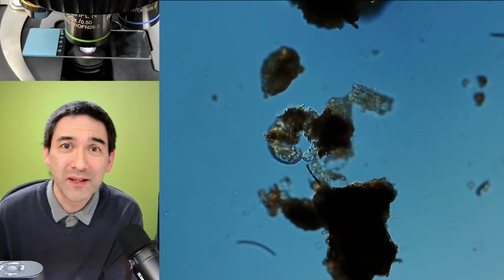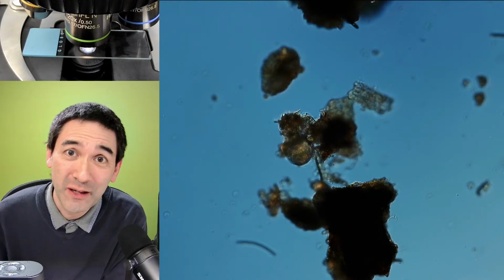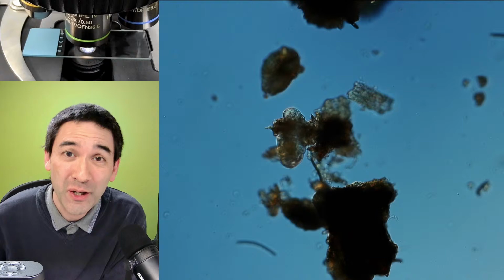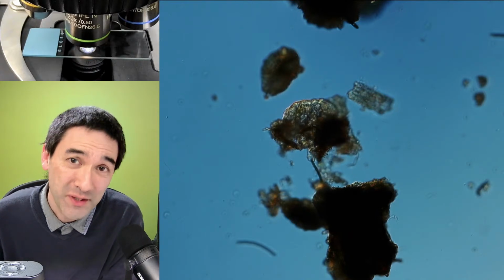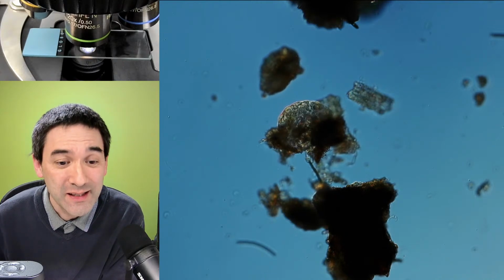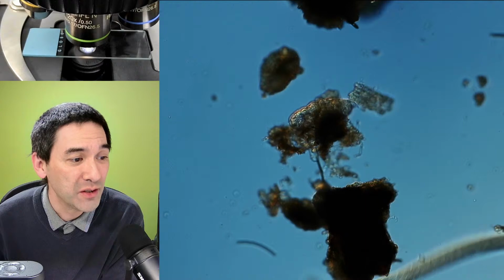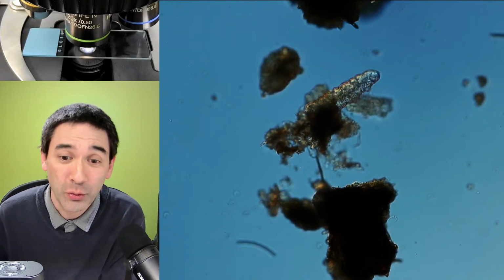Today, it's again the topic water bears, but specifically, I would like to show you how to construct a so-called Baerman funnel. I have been somewhat successful with that. I would like to explain to you what that actually is and how you can use it to catch water bears and also other microorganisms.